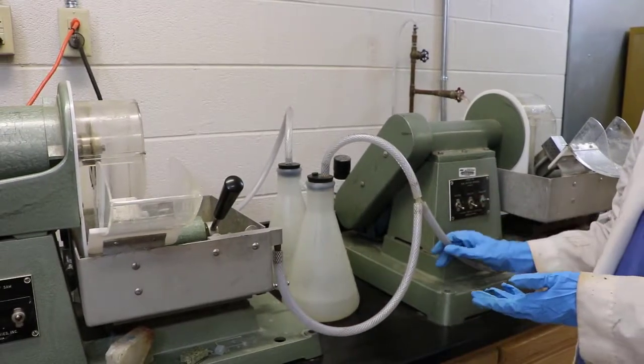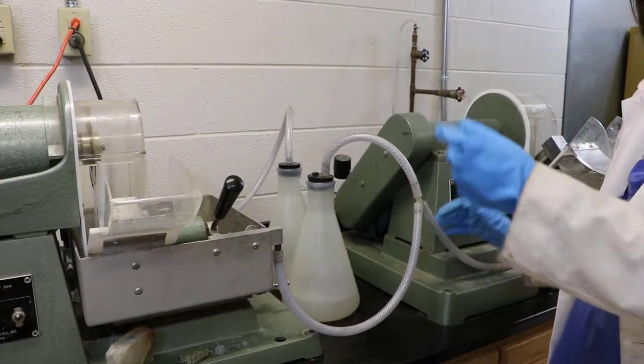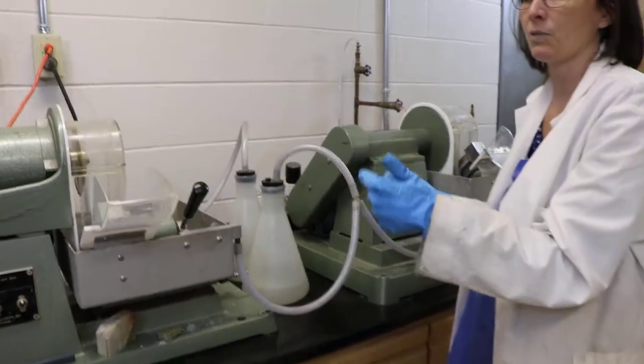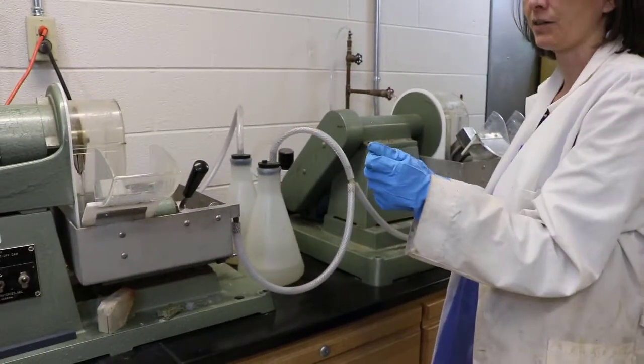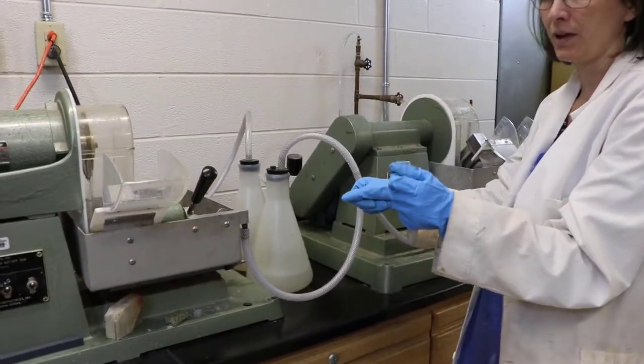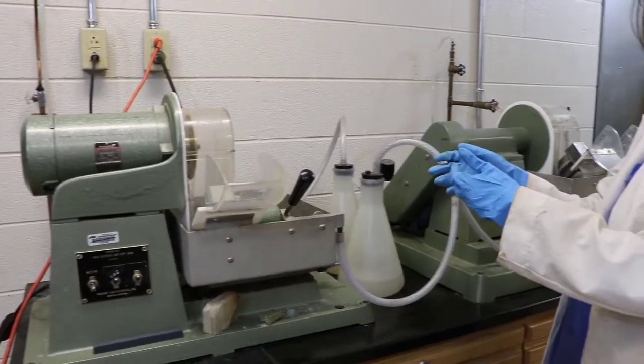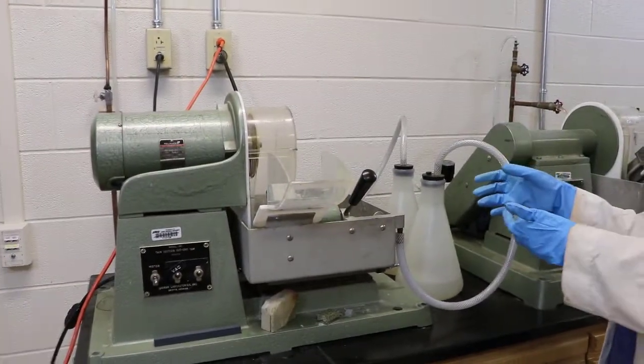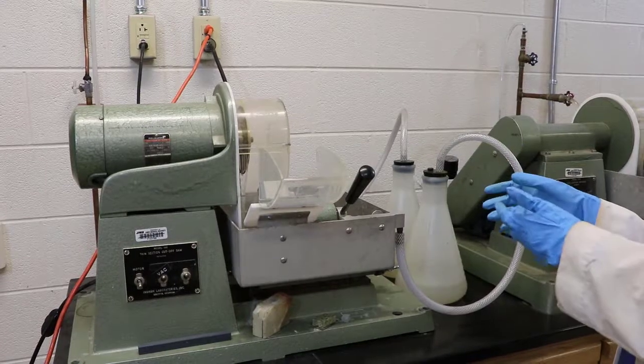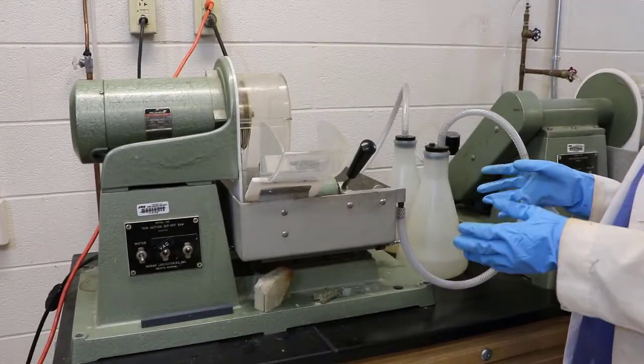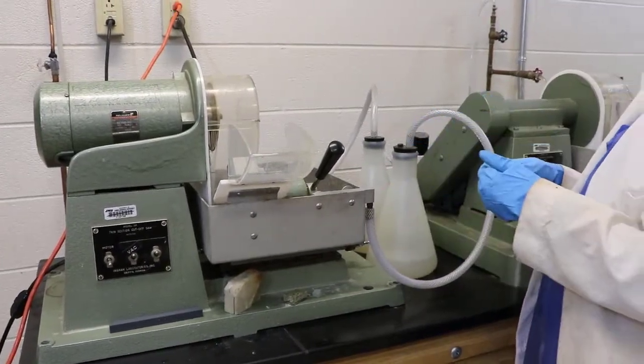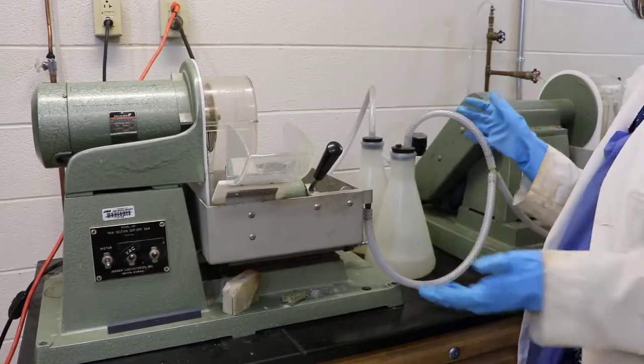Best practices though are always to turn the pump off before you vent it, meaning before you try to take your samples off you want to turn the pump off. And that keeps it from just sucking raw air into it. And eventually some pumps don't handle that very well, but this one can kind of handle it for a little bit. So to keep your sample attached, really with the setup, all you have to do is turn on the vacuum pump.